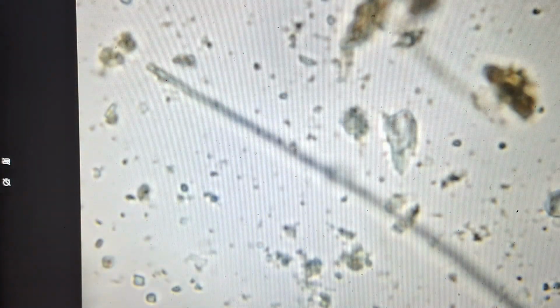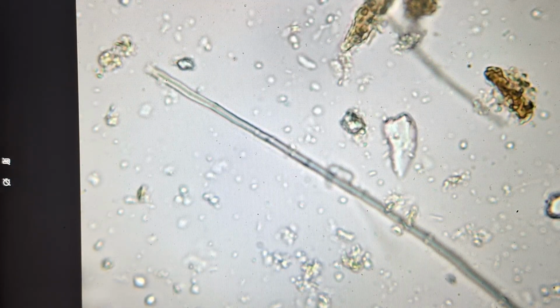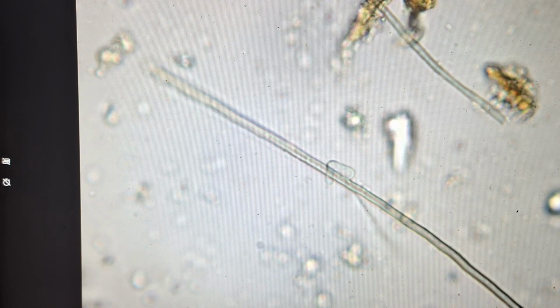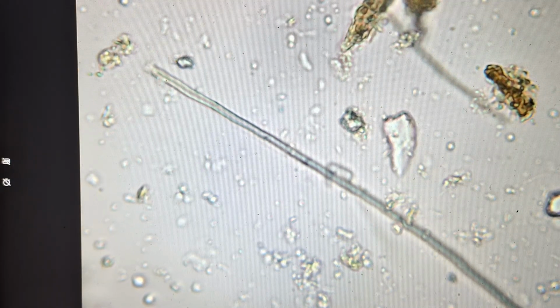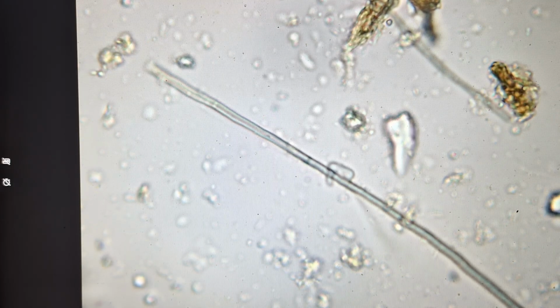I'm not sure what kind of fungi it is. I'd assume it's a saprophytic fungi, a decomposing fungi. Those bacteria in the background. What it does, it excretes a fluid around it, and that breaks down whatever it's feeding on, whether it's bacteria, organic matter, and is able to pull that fluid back inside itself.